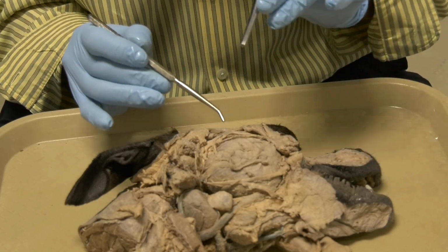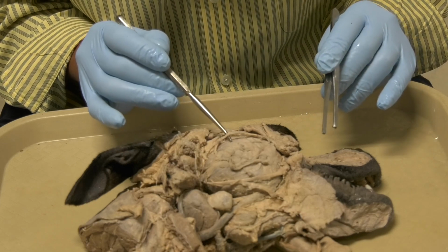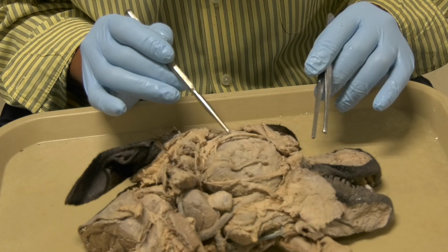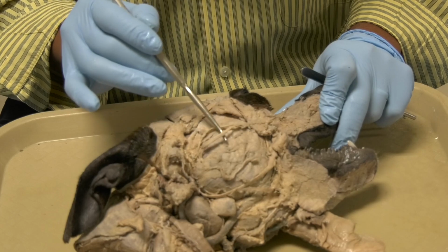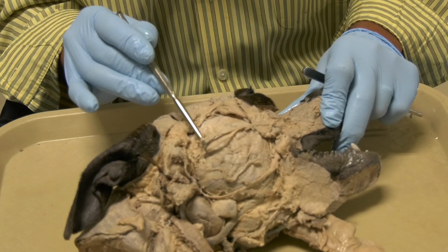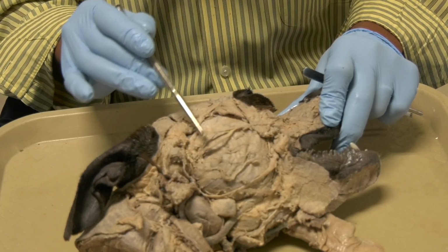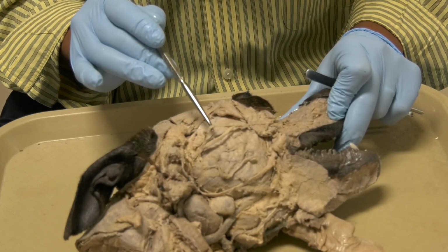But this one here, this is the auriculotemporal. It is sensory. Don't confuse it with the buccal, with the dorsal buccal, which is coming from the facial. This one is motor, okay, to the buccinator muscle. The auriculotemporal is a branch of the mandibular, and it is sensory to the face. Just bear that in mind.